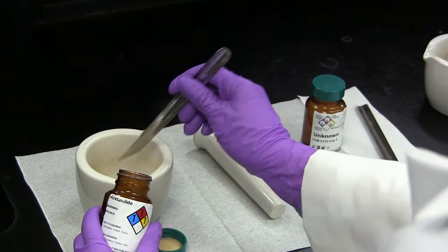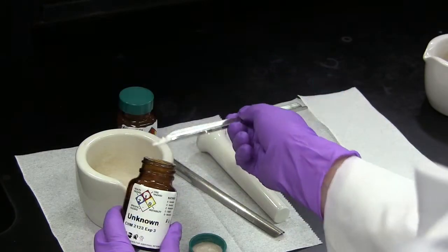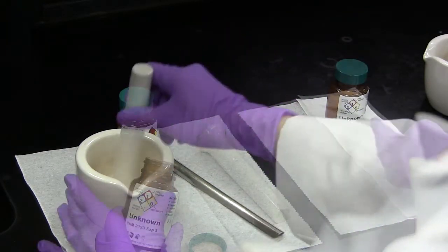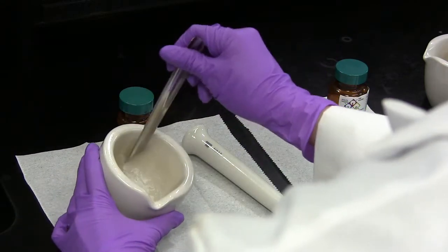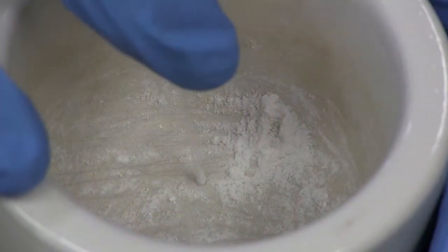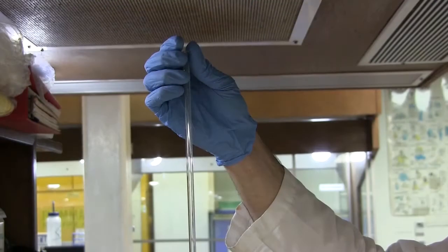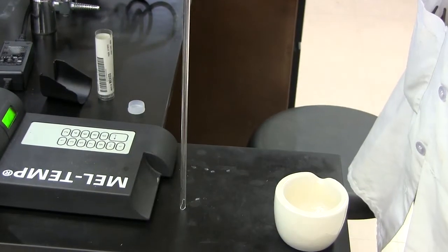Start by adding equal amounts of acetanilide and unknown to a mortar. Grind the contents with a pestle and fluff with a spatula to ensure the mixture is homogeneous. Pack the mixture into a capillary tube, then drop the capillary tube down a larger tube to further pack it.